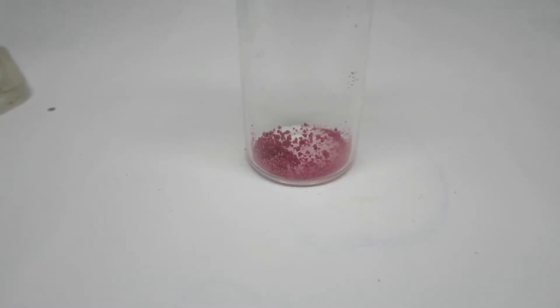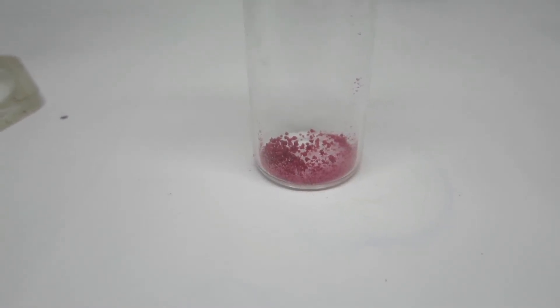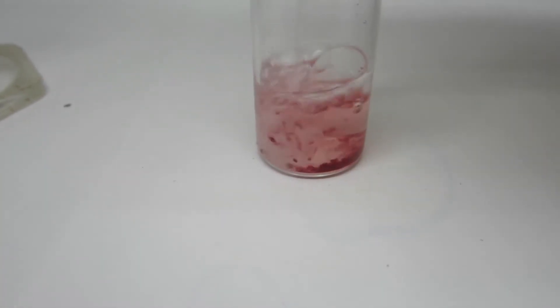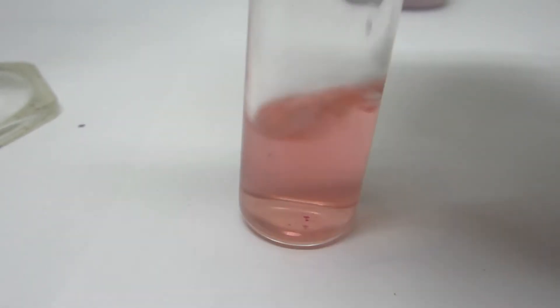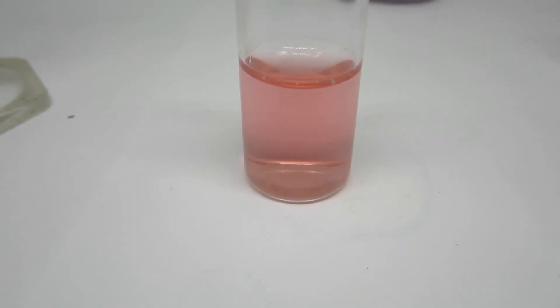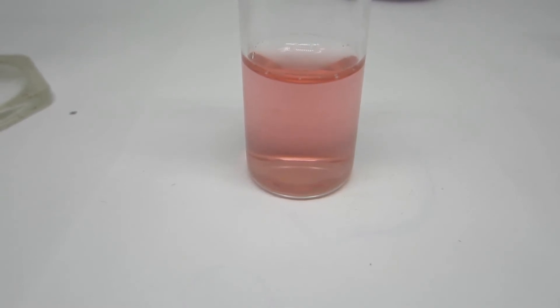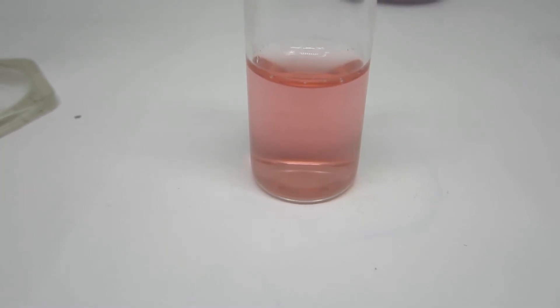The cobalt-chloride hexahydrate solid appears as a red powder. When this red powder is dissolved in water, the resulting solution is a pink or red solution of the cobalt-hexa-aqua complex. With a large excess of water, the chemical equilibrium shifts to ensure that all of the cobalt is bound to the water in the red complex.